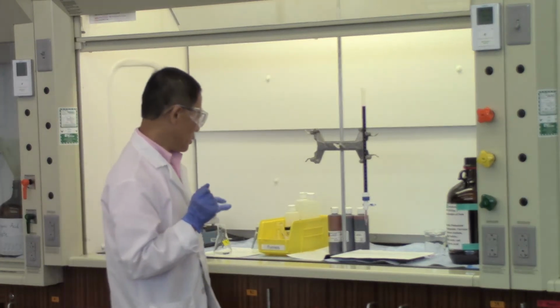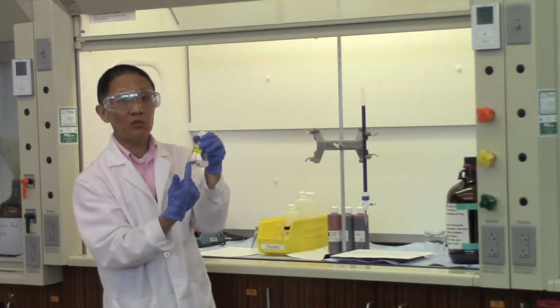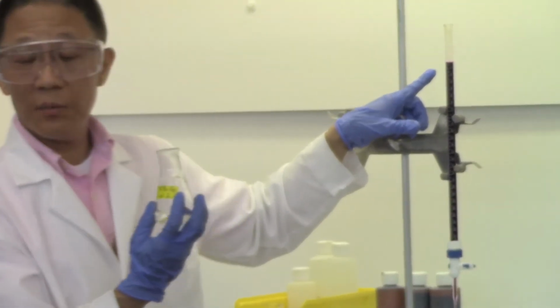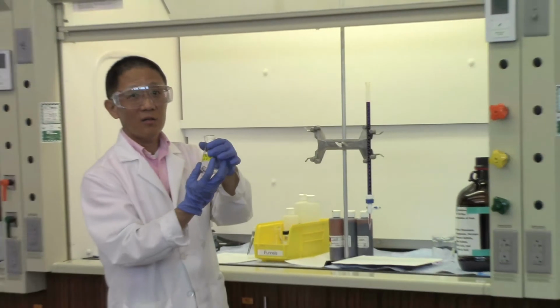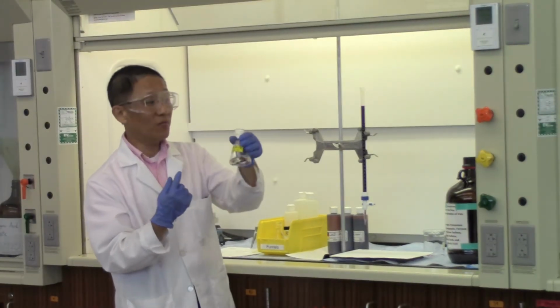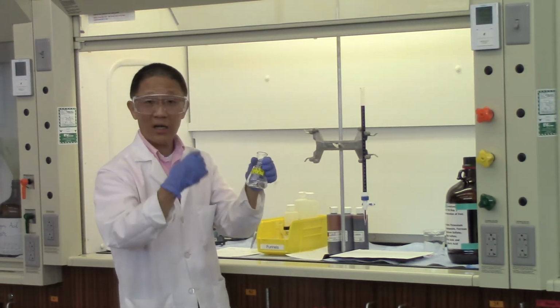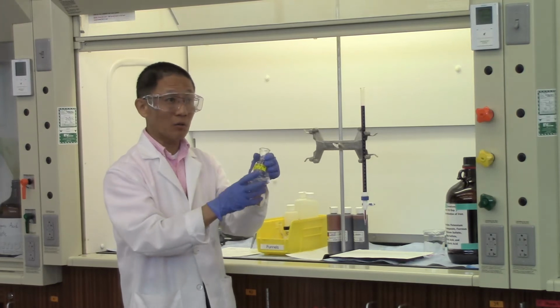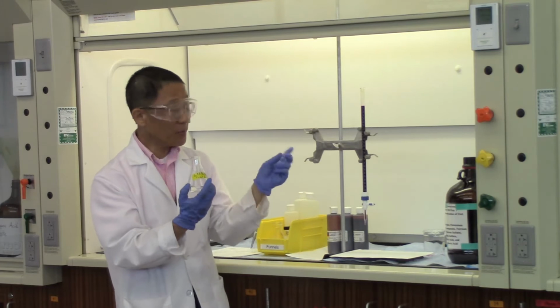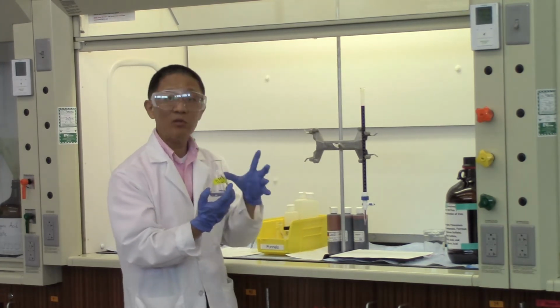So what we're trying to do here is that you have some Fe2+. As long as you have Fe2+ in here, the moment you put the potassium permanganate solution in here, you may see a brief presence of a pinkish solution. But if you swirl the flask, that pinkish color will disappear. You keep adding more KMnO4 into the solution, and then the pinkish color will disappear. The disappearance of the pinkish color will get slower and slower. And that's the time you need more patience.